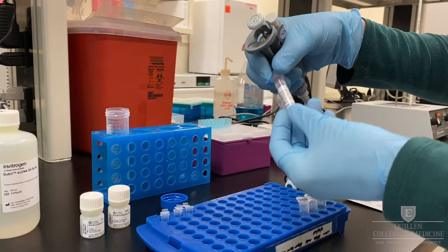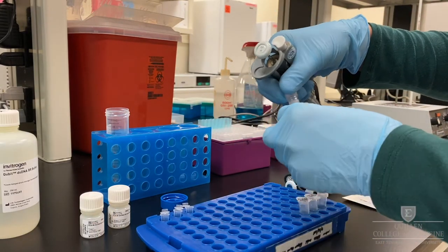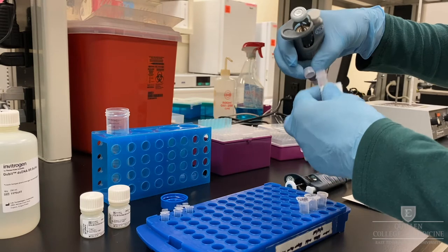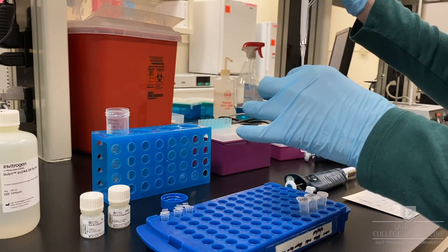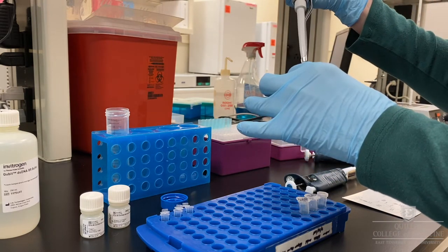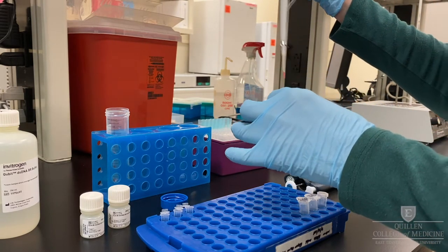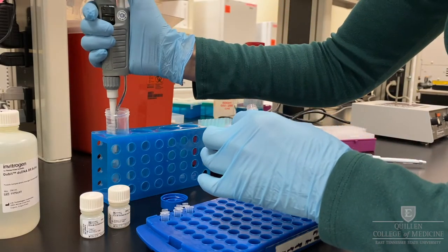To the dilution buffer, add our 200x fluorometric reagent — one microliter for each of your samples, the two standards, and however much excess you've chosen to make.